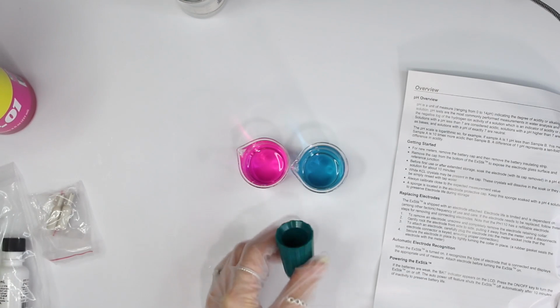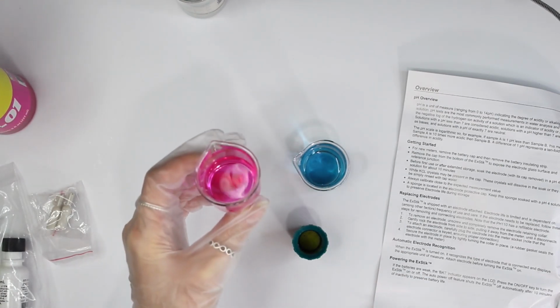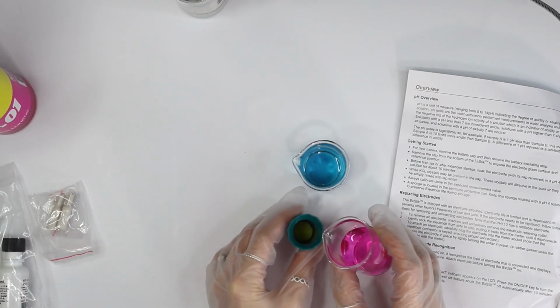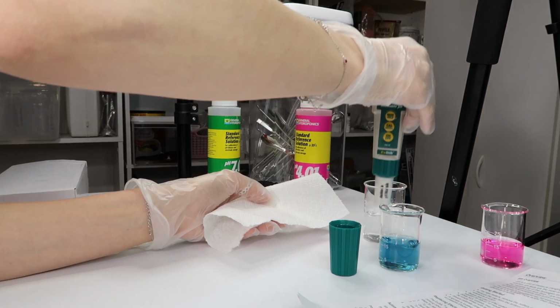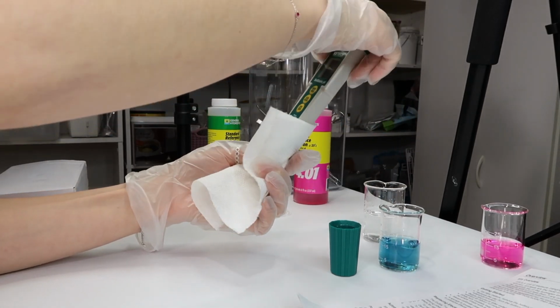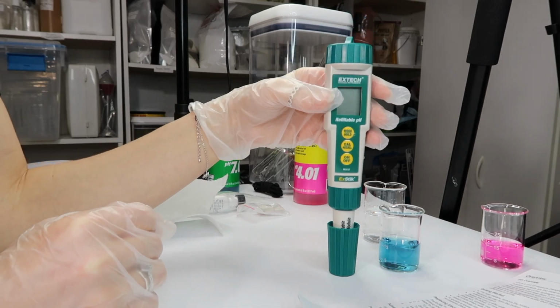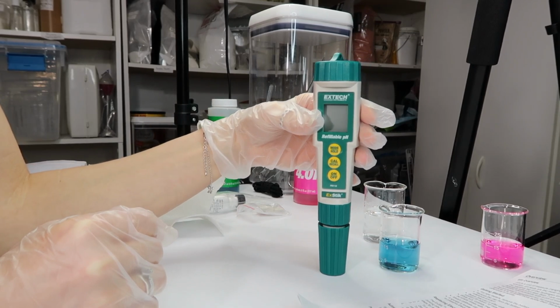And this pH meter specifically needs to be stored in a calibration solution of 4. So I'm gonna go ahead and pour a little bit of the 4 calibration solution into the cap. And after taking my pH meter out of the rinsing solution, I always just dry it off a little bit, and then just place your pH meter into your cup, and there you go. That's how you store it. And you will always want to keep it stored upright.